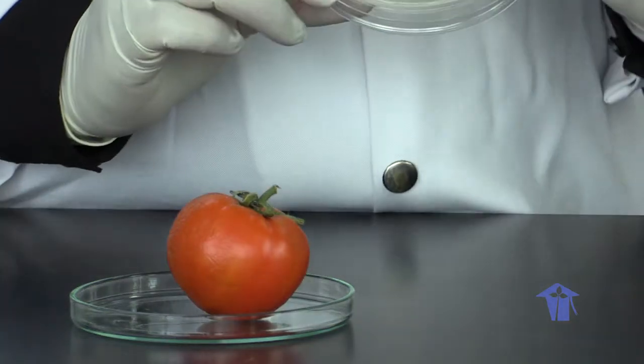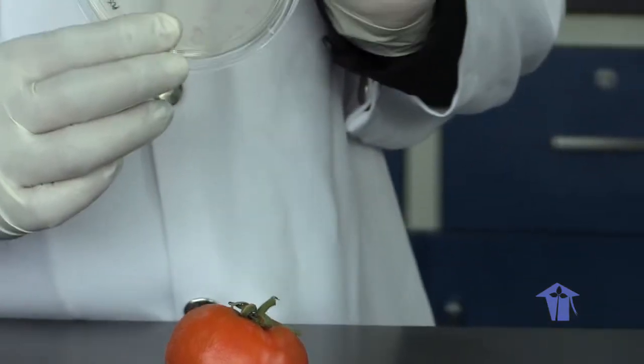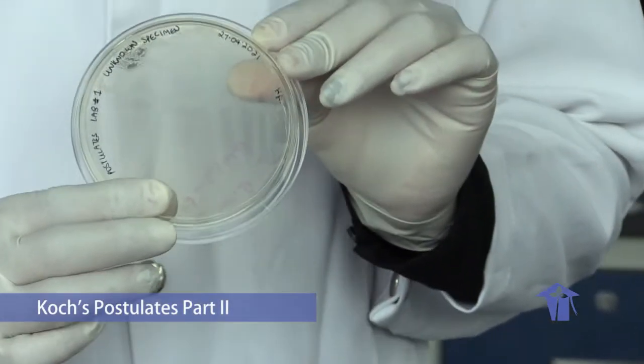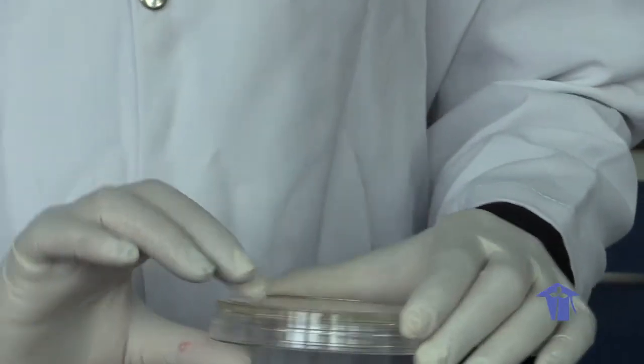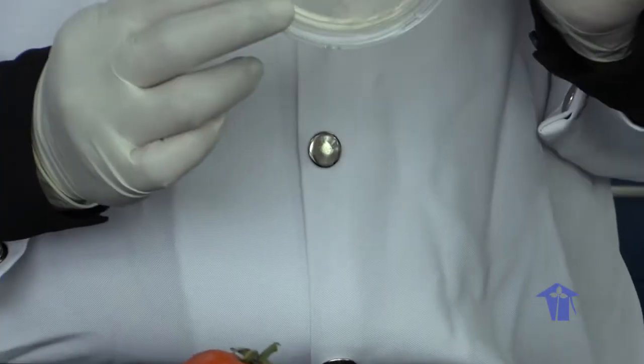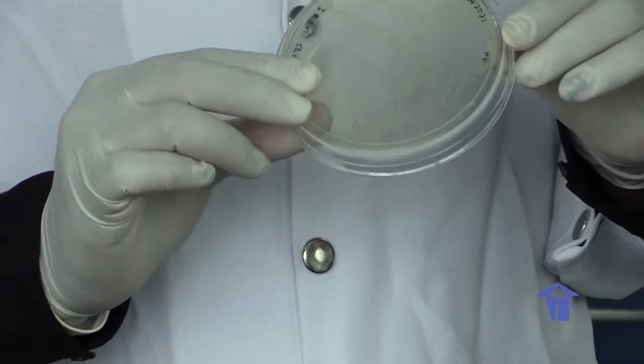So in the second part of our lab, we would have inoculated our sample. This will be used in lab 2 of Koch's postulates. In this part of our lab, our causal organism has been isolated in pure culture. We are observing our organism and looking at its morphology.